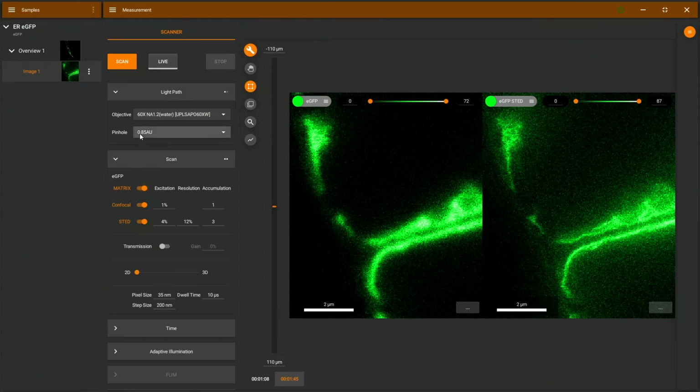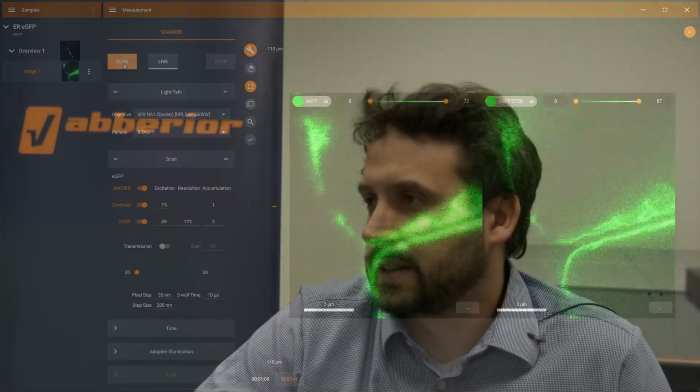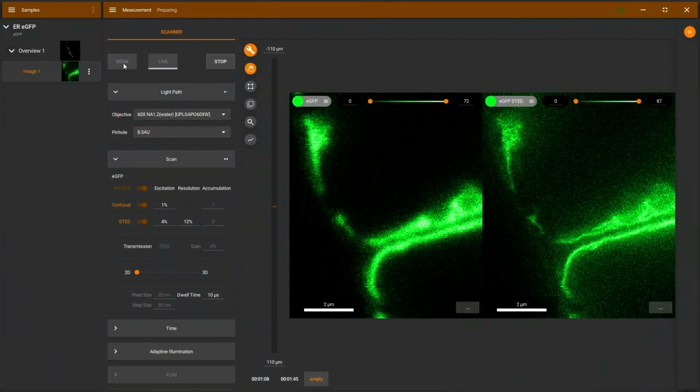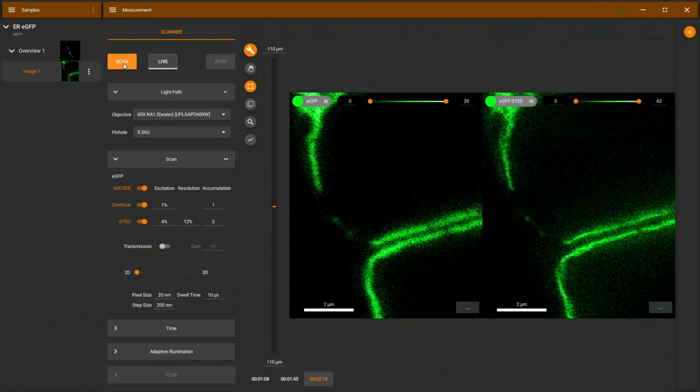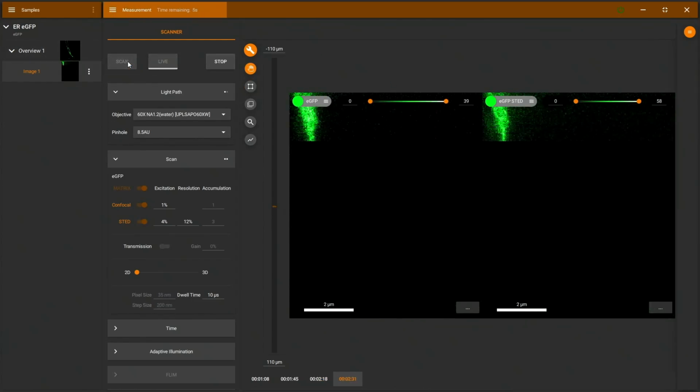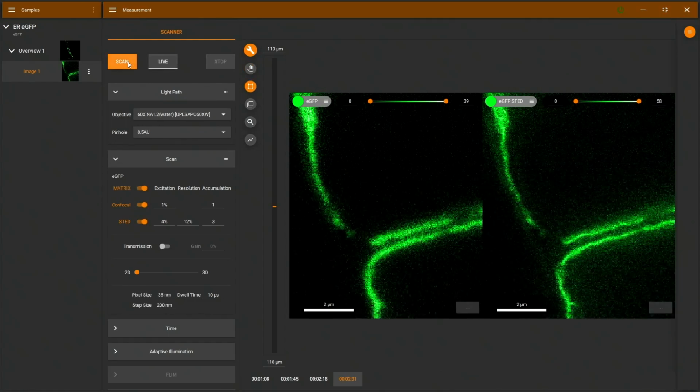So I'll switch to matrix, and as before I open the pinhole. So pinhole open, matrix on, scan, and when we are scanning, we will see again the virtual pinhole image. And I think what's striking here is that the background haze is really non-existent in the STED image. I'll scan again because I think things moved a little bit, and before we had more strings here. I don't know, scanning maybe another time just to see the difference.